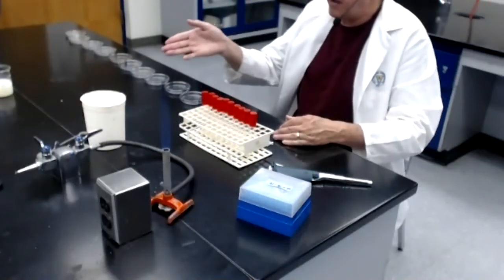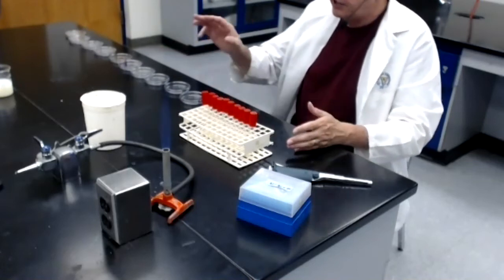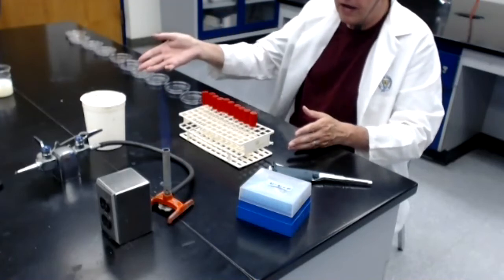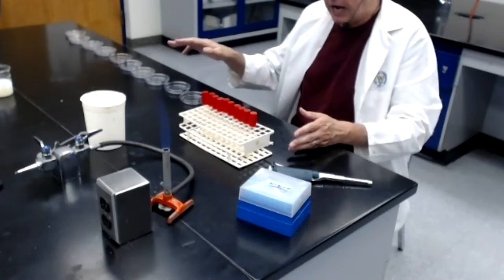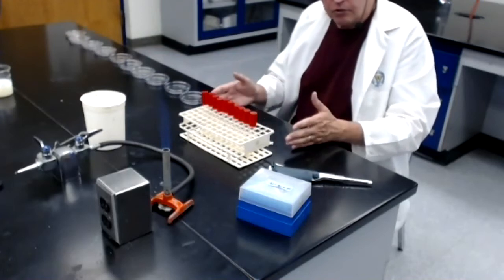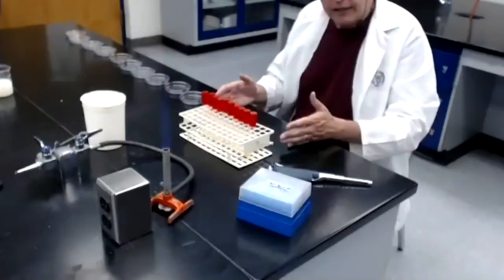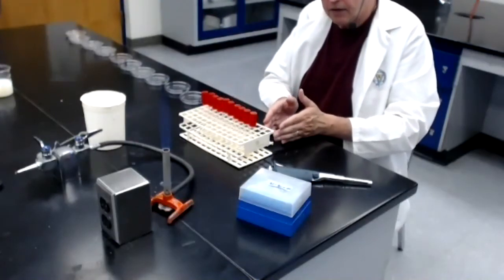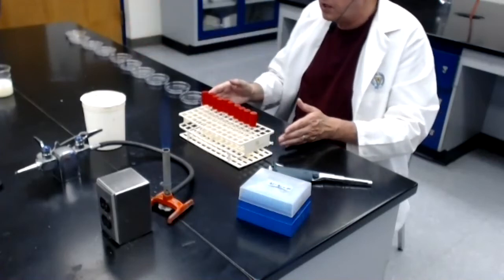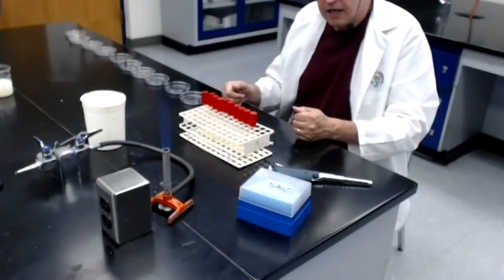Now, the volume of agar I'm using could be different. I could do 15 mils of agar or 20 mils of agar. I've had students in the past get a little bit confused about this. Since we use 10 mils of agar, they think that, oh, that's another dilution. It's not. The dilutions are all done. Whatever I do after this does not dilute the bacteria anymore or any less. All we're doing is we're transferring 1 mil from each of the dilution tubes into each of 10 different tubes of already melted sterile tryptic soy agar that's at 55 degrees C.